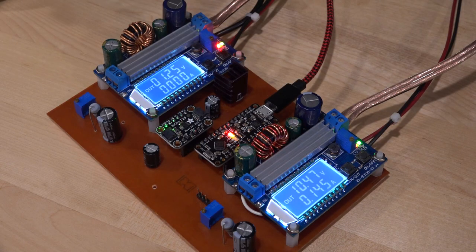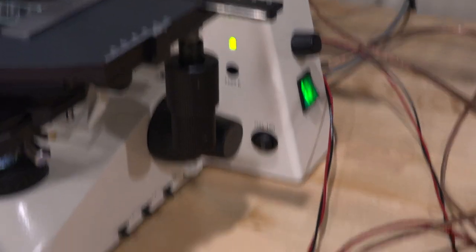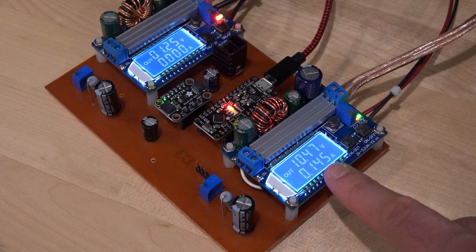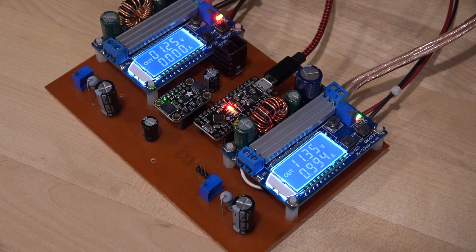Here we go, everything's plugged in, and right now the microscope is at the lowest intensity and using the bottom light. So if you look at the currents, you can see that this one is active and this one is at zero. If I crank up the microscope's light intensity, you can see the bottom one's current increases like so. And if I just jump to the top one, you can see that immediately switches to the top one.